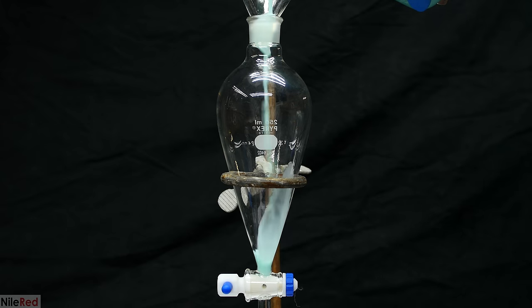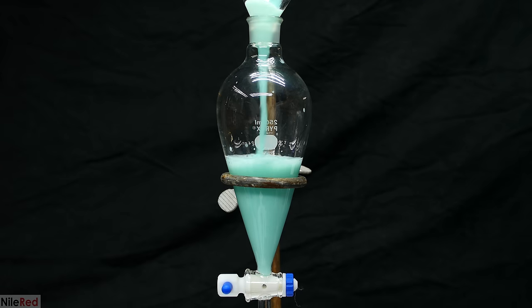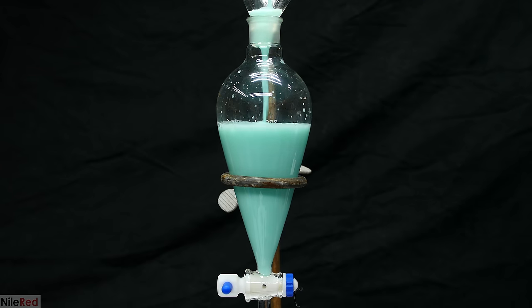Everything was transferred to a separatory funnel, and it's time to extract our cadaverine. In theory, I could have filtered off all the nickel salt that formed, but there's honestly really no point.